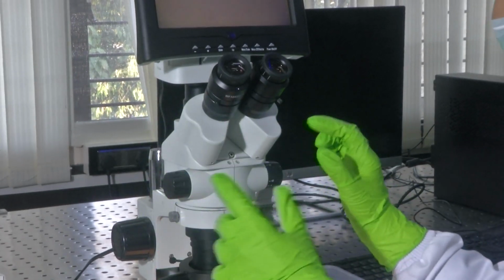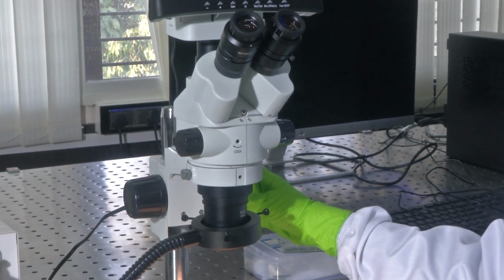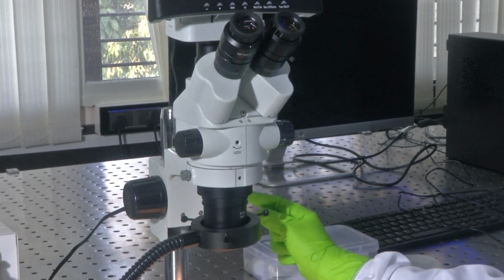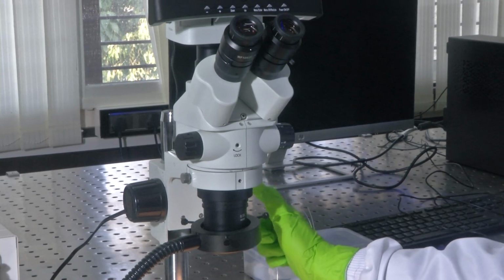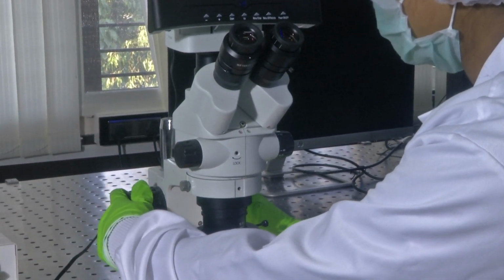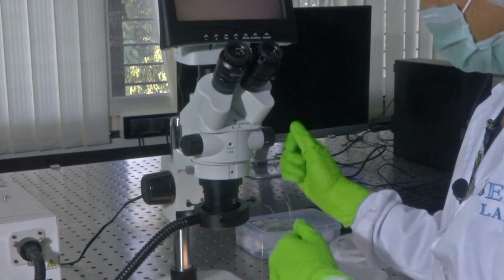Once this adjustment is made, say your sample is sitting on the desk, now how do we adjust the magnification? There is one knob here to adjust your focus. The knobs here can be used to adjust focus. Now that we do not have a sample, let me show you while I keep a sample, and then we could adjust the features.